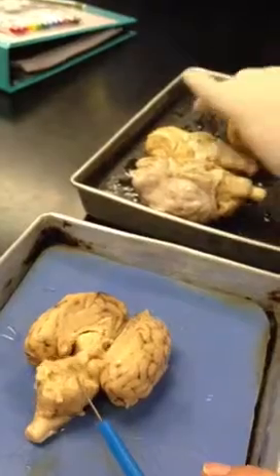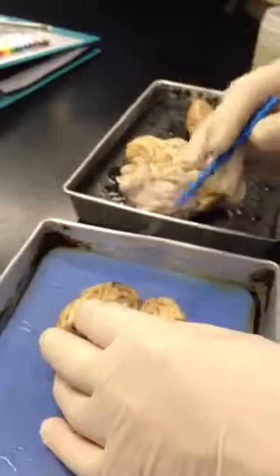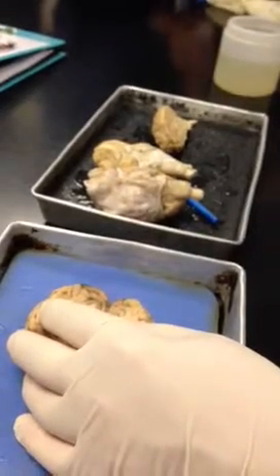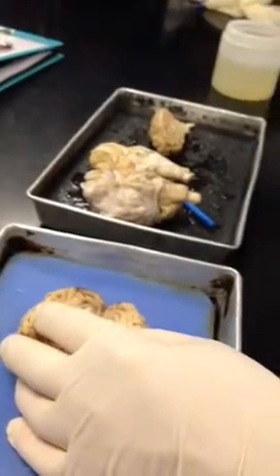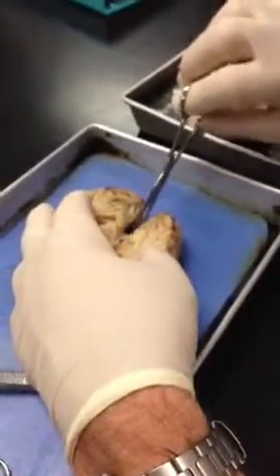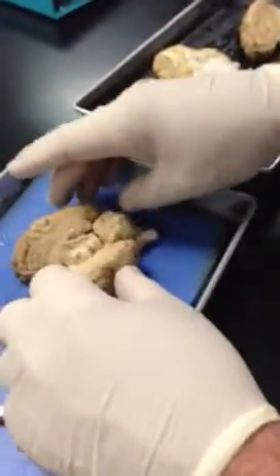Let's see, what else do we have on this one? Let me look at this one. Does anybody have a scalpel? Or got a knife? No, like a knife. Okay, well, a pair of scissors will have to do. Oh, here you got a pair. Well, those are funky. Here, I just wanted to cut this thing in half so we could see a little bit more detail. Okay, that'll work. Yeah, it's a little better on this side.